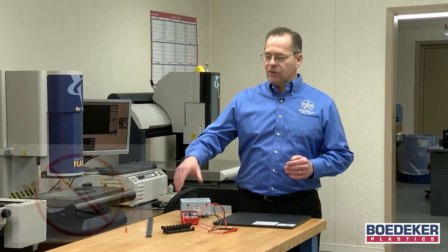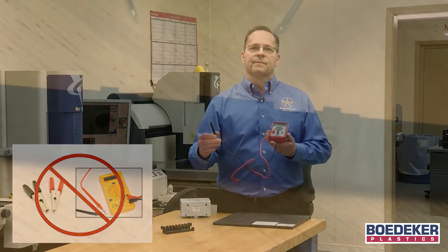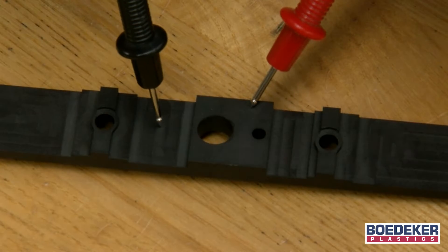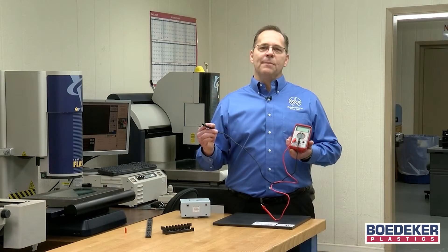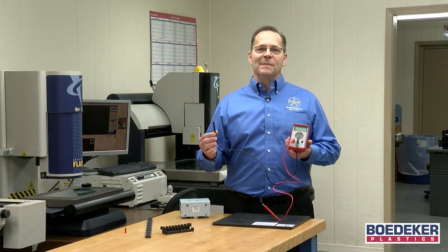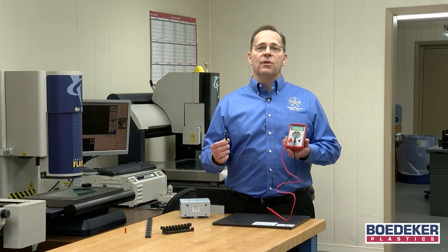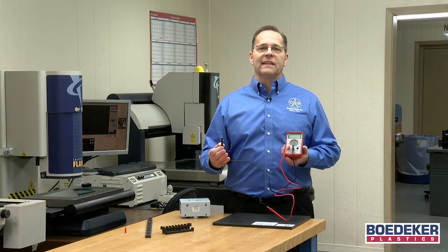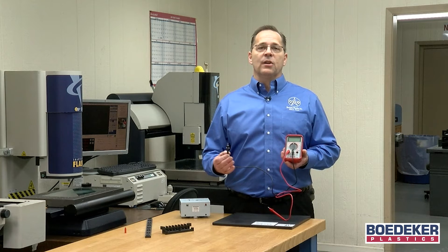Many people try to measure their ESD materials using simple electrical volt meters which use point-to-point probes. The results are extremely variable and completely inaccurate. These types of meters will not yield accurate results for ESD materials, though they are accurate for fully homogeneous materials like fully insulative plastics or fully conductive metal plates.